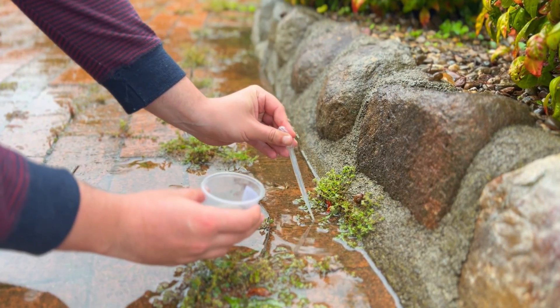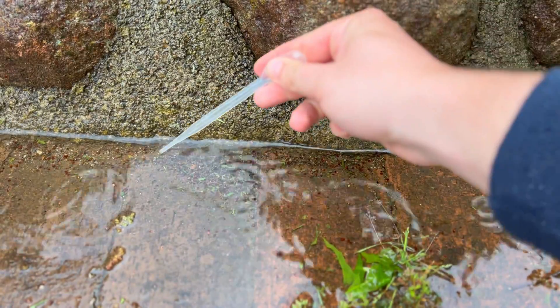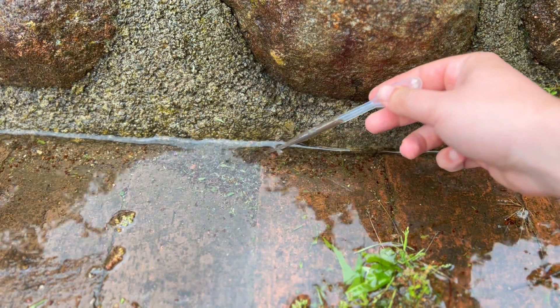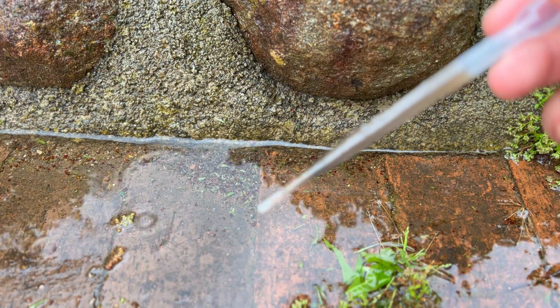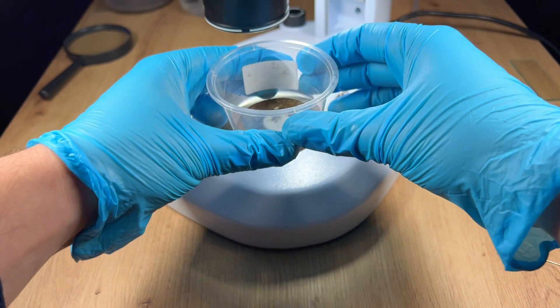After the rain has stopped, the puddles that are left behind bring to life the dormant microbes. And so when collecting the sample, you want to make sure that you get a lot of this nice rich mud. Cracks and crevices between bricks and rock will almost certainly guarantee you a water bear.